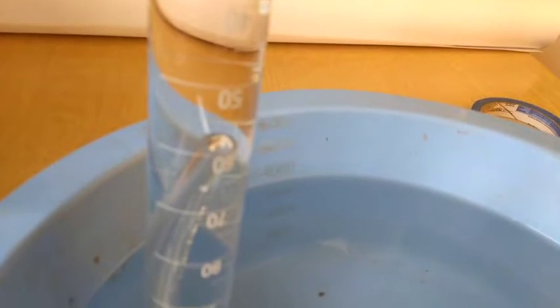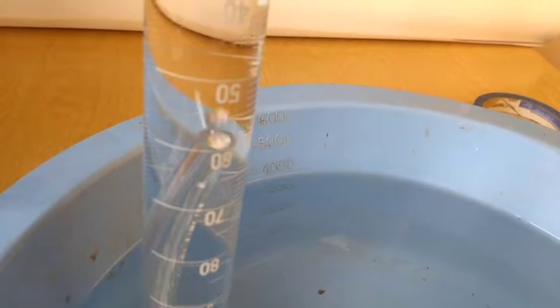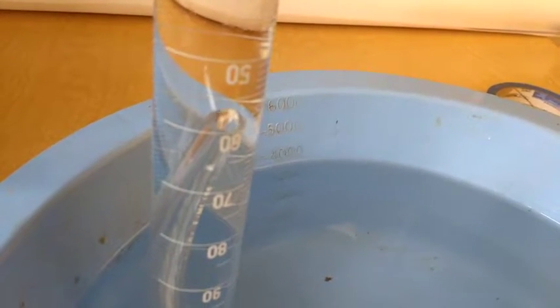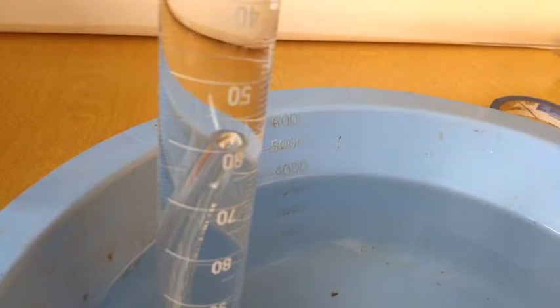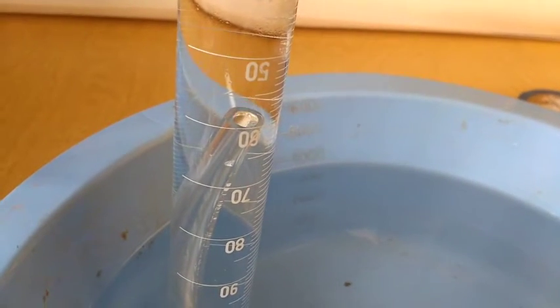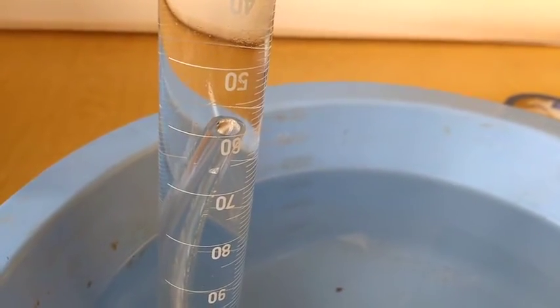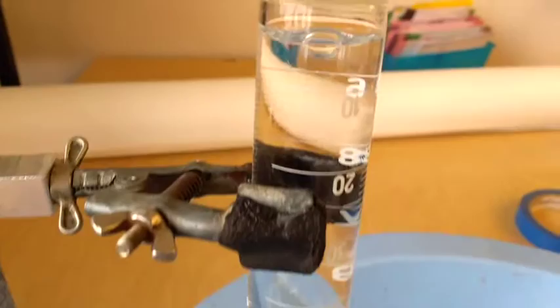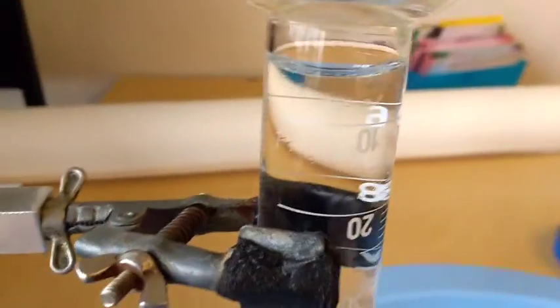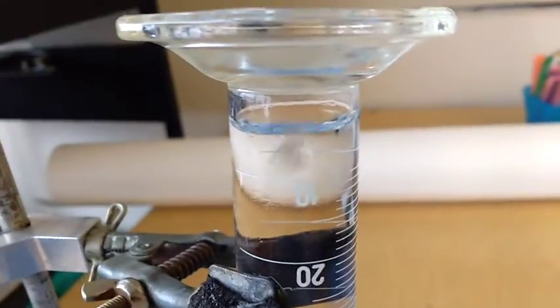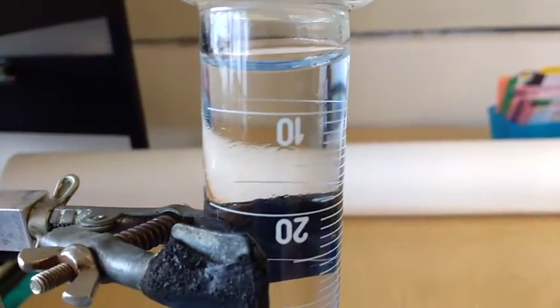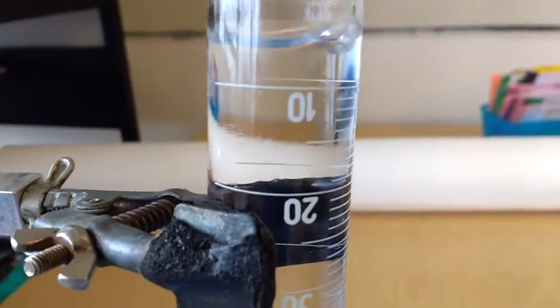So if we then come over here and take a look, see if I can get it to focus, you can see that gas is being made. And now to measure that, you'll need to, during this time, be taking a time measurement and be watching near the top to see how many milliliters of gas are being created over a certain amount of time.